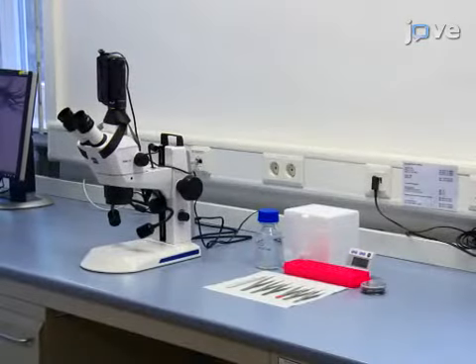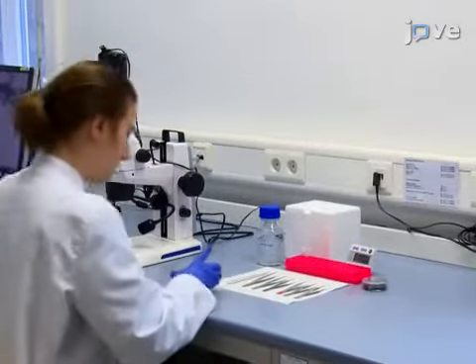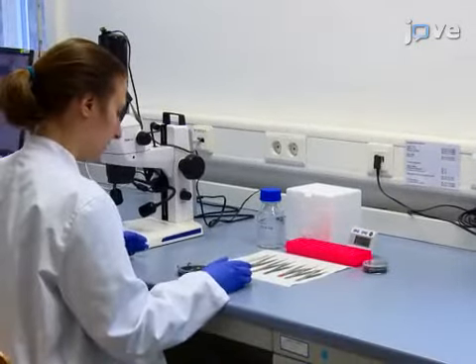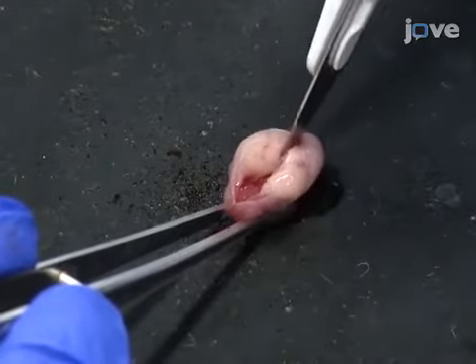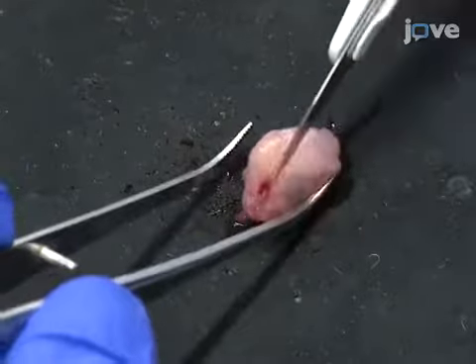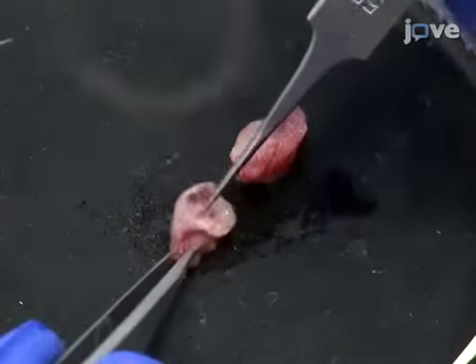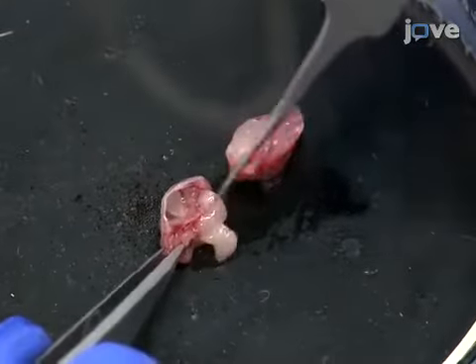After preparing reagents and tissue from experimental animals, at developmental stage E16.5 to P3, use a scalpel blade or a small pair of scissors to dissect the head along the sagittal midline, beginning at the nose and extending caudally. Remove the brain from each half of the skull with a pair of forceps.